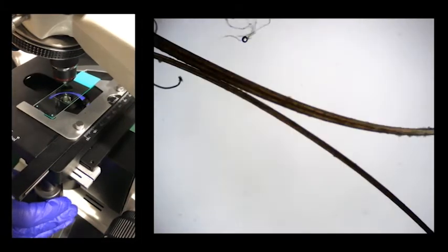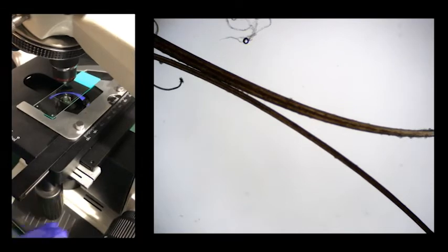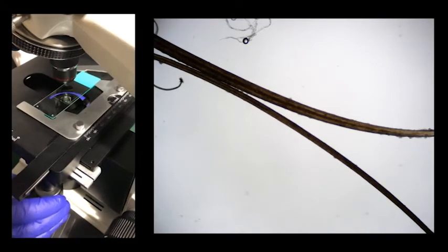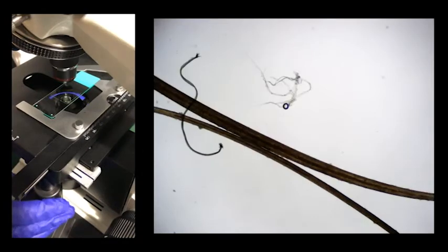Okay, so we use the smaller knob called the fine adjustment knob to focus in a little bit better. Now that's some pretty cool detail. Let me see if I can show you some more of it.